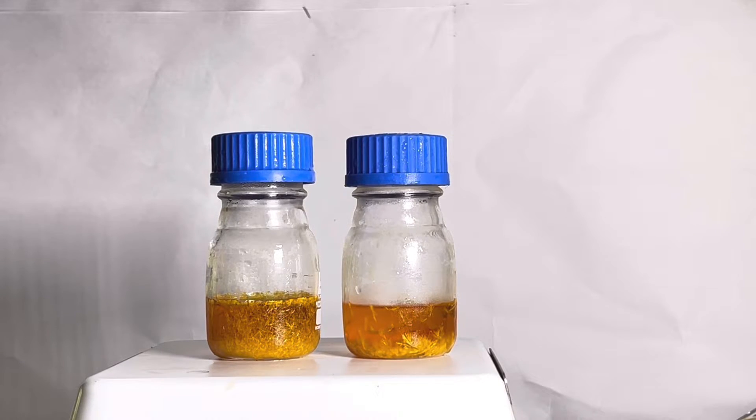For some reason I did the recrystallization in two separate batches and let them cool down. In the bottle on the right side we had less product and slow cooling was done, and this led to the formation of longer crystals. On the left side we had low amount of solvent and larger amount of the product, and this led to the formation of smaller crystals.